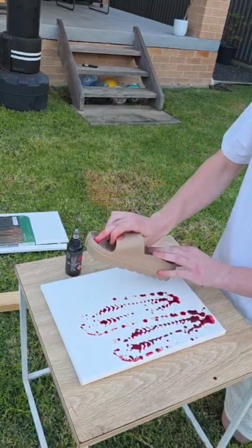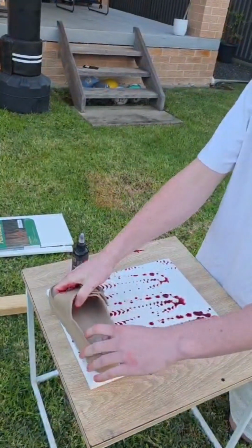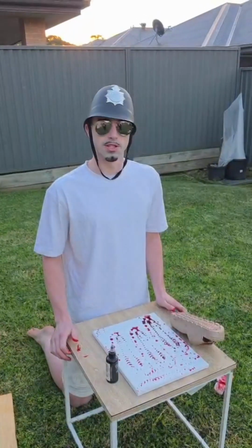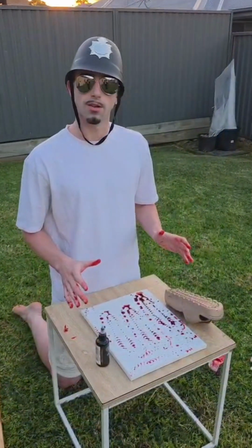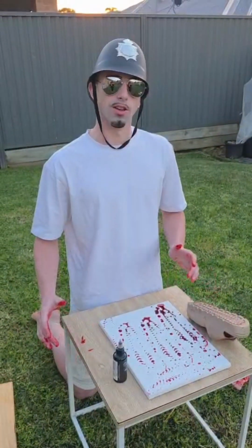And as you can see, it gets a little bit lighter and lighter the more we go. When forensic scientists look at something like this, they always try to find the darker bit first and the lighter bit last, where the dark is the start of where they began and the light is where they finished.